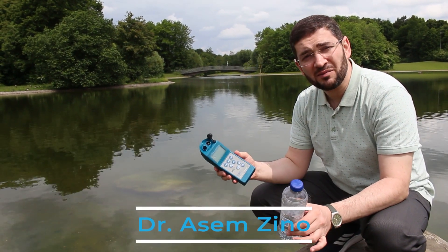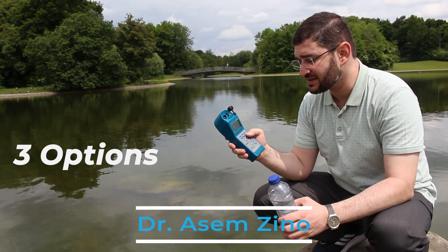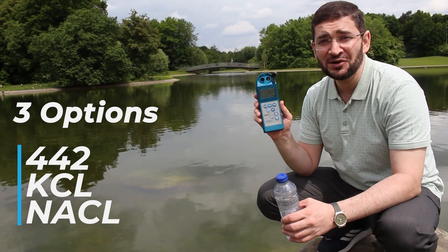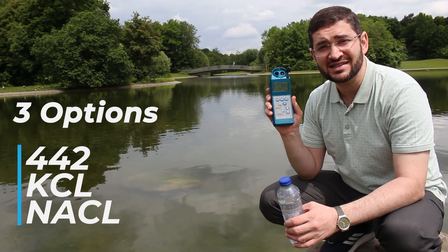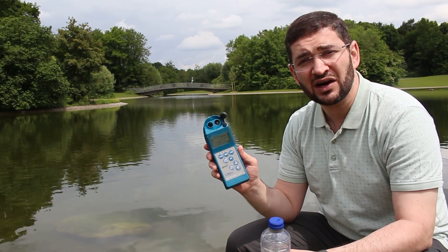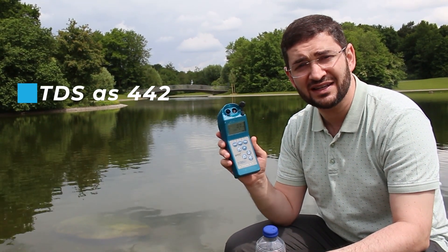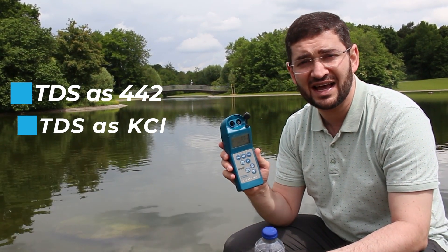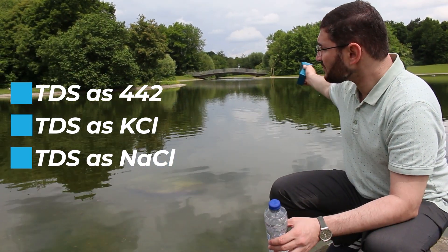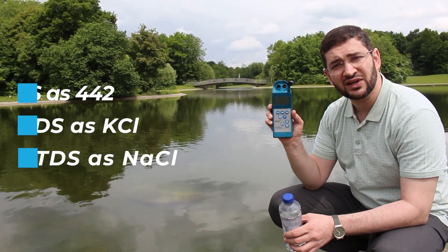When you want to measure TDS of any water body, we have three options: measure TDS as 442, measure TDS as KCL, or measure TDS as NaCl. We are going to discuss in detail the differences between these three options, but for such water bodies here we can use the option of measuring TDS as 442.